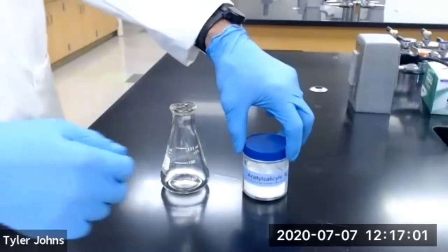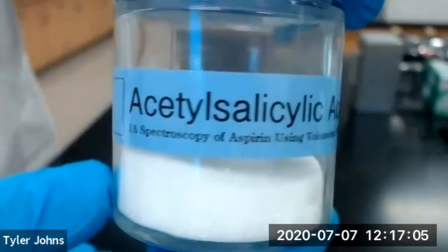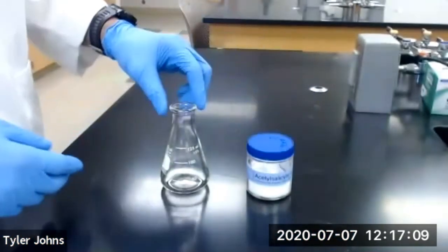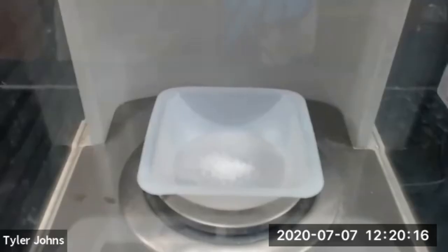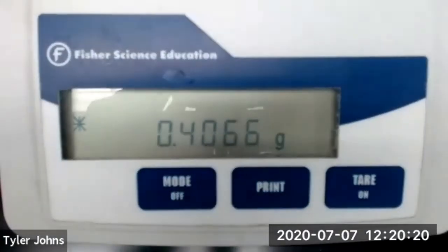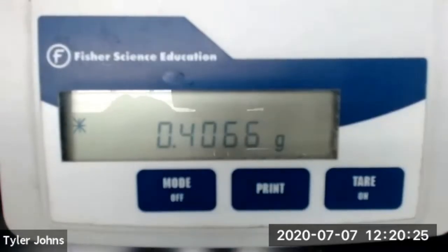Let's get started. The first thing we need to do is mass approximately 0.4 grams of acetyl salicylic acid and add it to a 125 ml Erlenmeyer flask. The mass of our acetyl salicylic acid is 0.4066 grams.